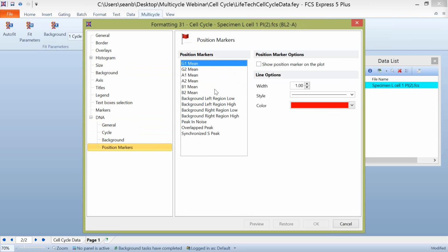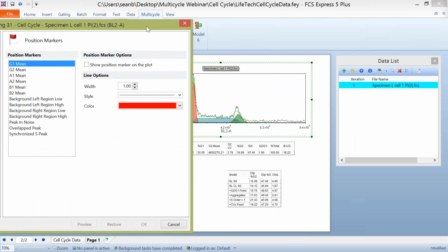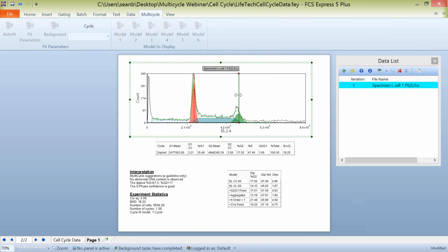Now, I'm going to start with position markers. I find this a very useful tool in Multicycle. What we can actually do is say, if we want to show where the G1 mean is, and if we'd like to show where the G2 mean is, you can show this position marker on the plot. I'm also going to make my position marker for the G2 mean be green, and I'll up the size of these a little bit so it's a little bit easier to see for everybody at home, and click Preview. And you can notice now on our Multicycle plot, we have these little bars here for where our peak mean values for the G1 and G2 are. I'm going to choose them to display for now, and we're going to come back to them and show you how you can actually use them to start changing some things about how this data is being modeled.